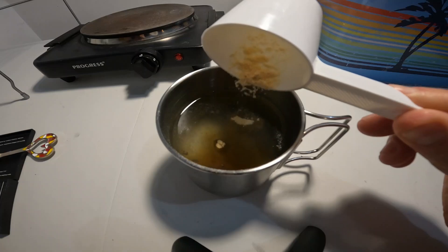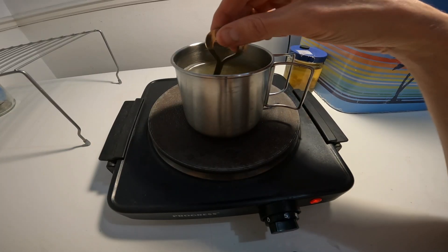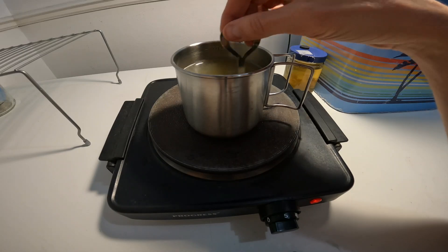I made sure to only add the powders to cold water, otherwise everything clumps together. I began to heat everything to dissolve the powders.